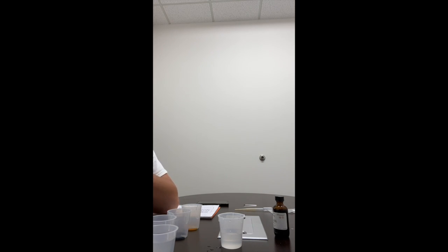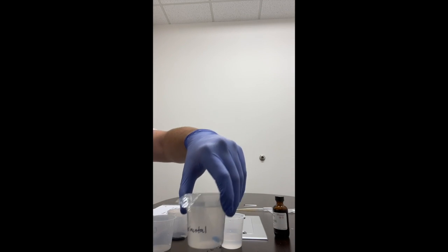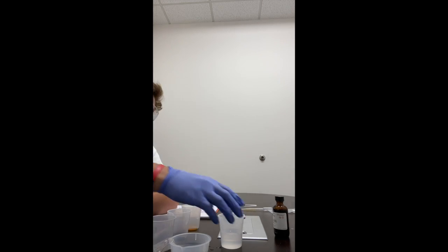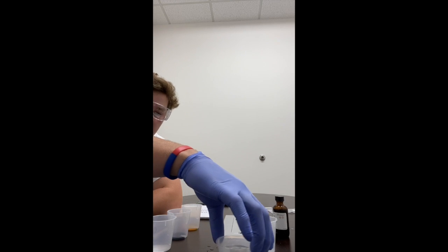So we place the filled dialysis bag into the experimental beaker, leaving it draped open like that. After the solution has diffused for 60 minutes, remove the dialysis bag from the beaker and empty the contents of the bag into a clean, dry beaker. Label the beaker dialysis bag solution. Okay. So we will let that sit for an hour, and we will be back with more results.